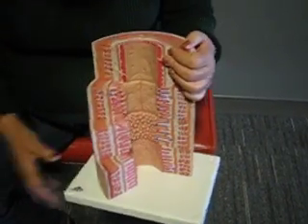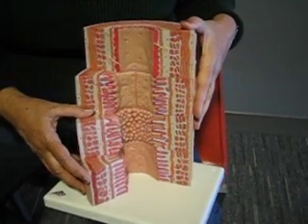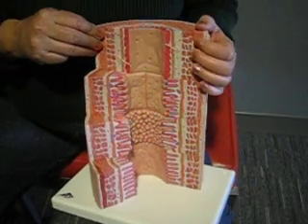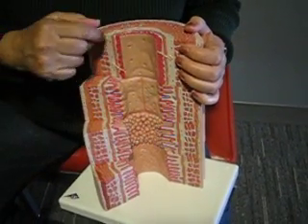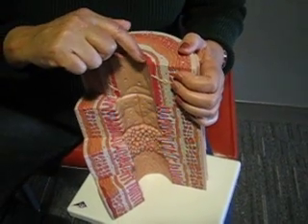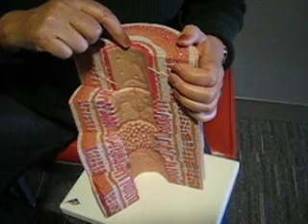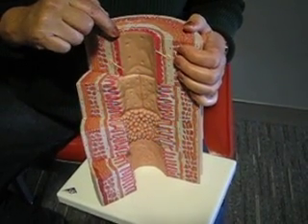Okay. What we see here is 4 sections of the histology of the GI tract. The first one up here is supposed to represent the esophagus. This is all mucous membrane here because it's open to the outside. In the esophagus, continuing from the part of the pharynx down to the esophagus, we have stratified squamous because of wear and tear.